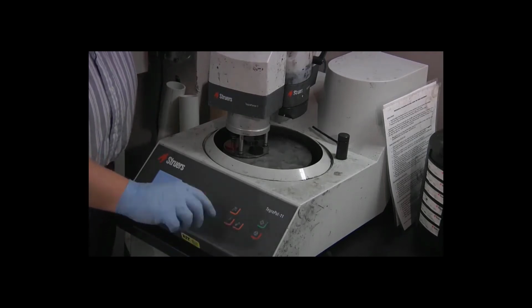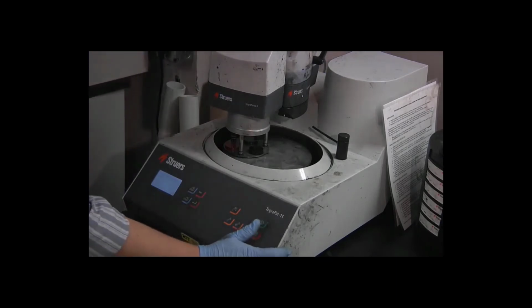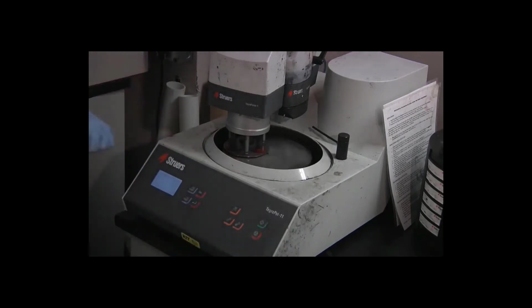Looks like a spray nozzle with a diamond in the spray. That will force the dispenser to put out 1 drop of material. If nothing happens when we hit it the first time, we do it again until we do get 1 drop of material onto the surface of the disc. So as I press start, I will lean down and watch that nozzle carefully. I did get a drop of material, and so the process is good to go.